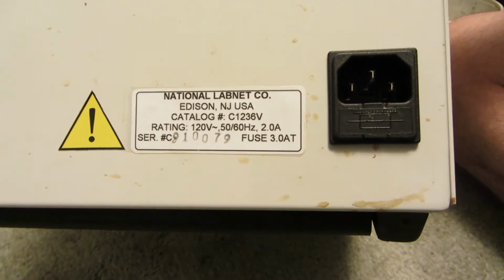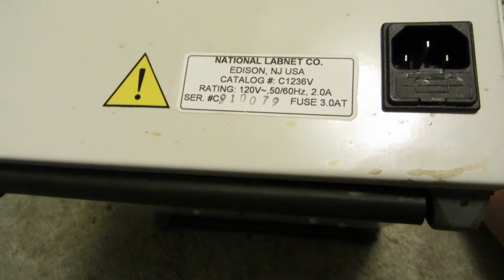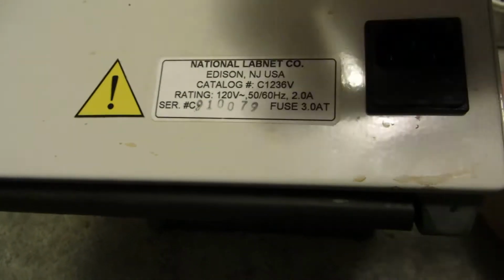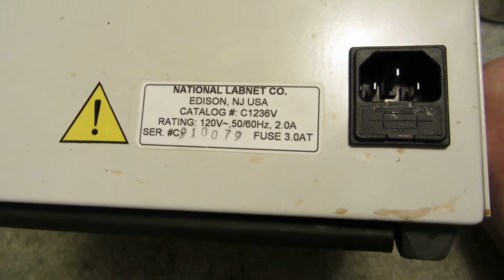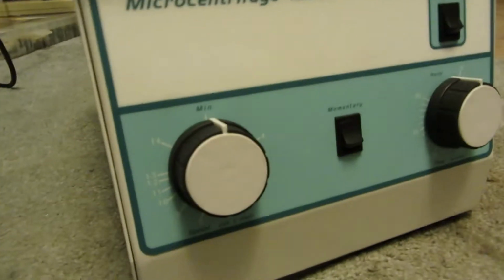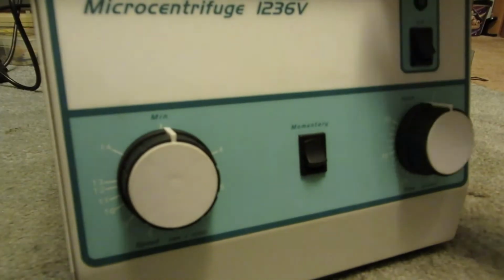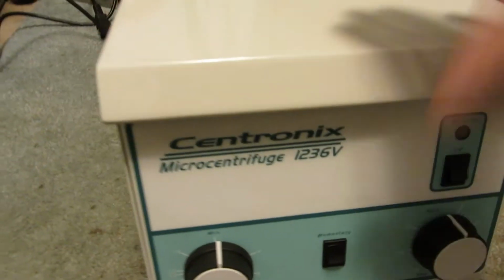It's not too much to it. I don't know, it might have been made in 79. Even this was made by an Edison company. I wonder if it's the same company that made the Edison motor I already have a video on. Some padding underneath. Don't know why that's there, but it is. And this lid cannot be opened unless there is power going to this.